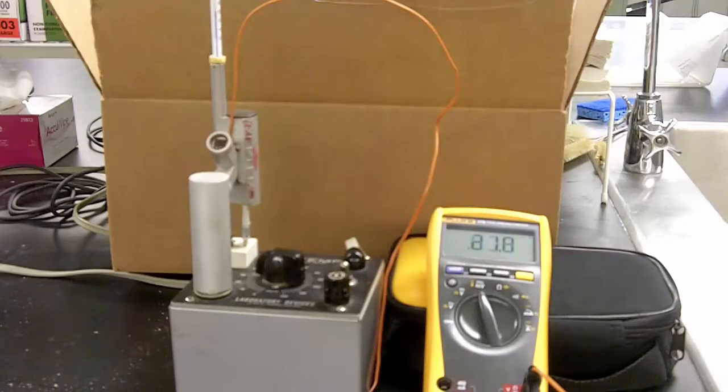In this video we're going to be looking at what's called thermometer lag from a meltemp when you're doing a melting point experiment. Before we get into the actual experiment, a moment about the setup: we've got a thermocouple reading a digital thermometer which will measure inside the sample chamber of the meltemp.